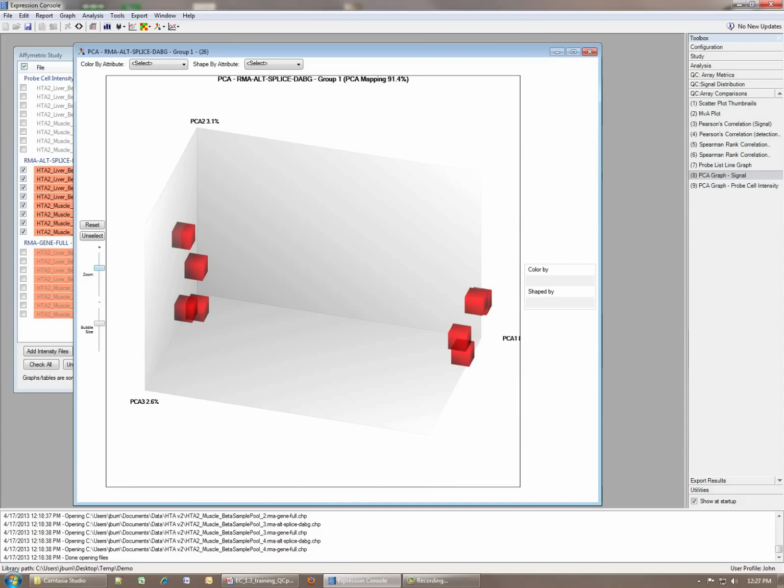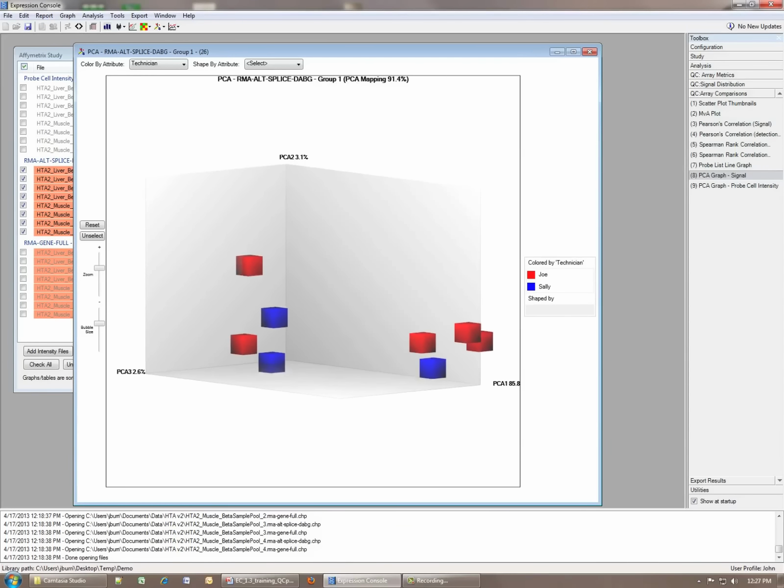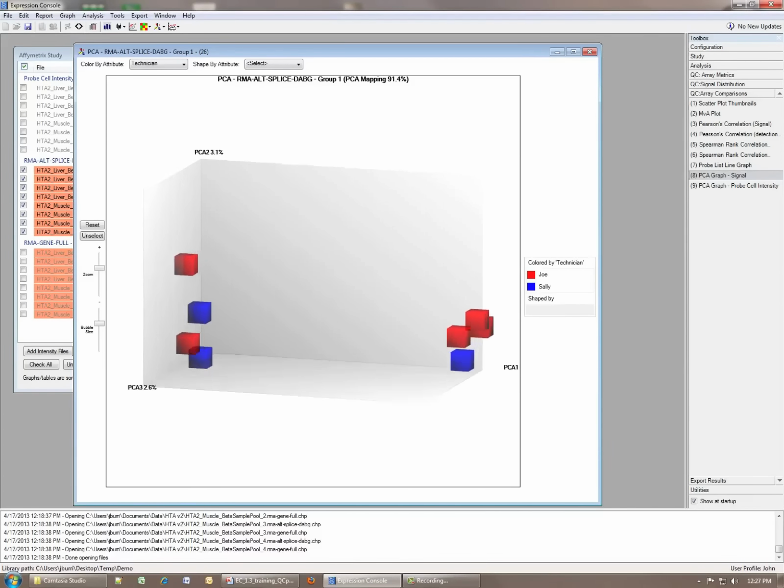So if we look first at, we'll color these by technician, and we'll see that in fact if you click in here, it's possible to rotate your graph around. You can see that both Sally and Joe are part of this cluster and Sally and Joe are part of this cluster. So that means that the 2 things that are driving these 2 data apart is not related to the technician in this case. We don't have a confounding factor variable based on Sally or Joe, and we haven't had any obvious sample swap.